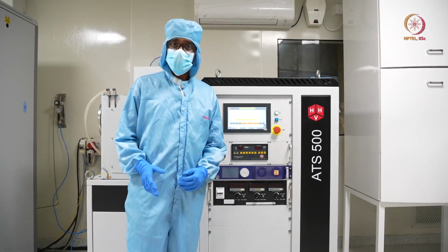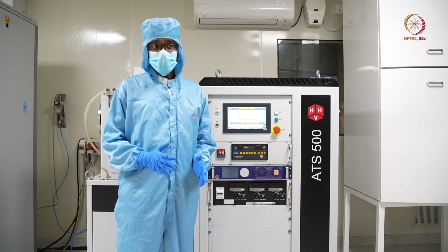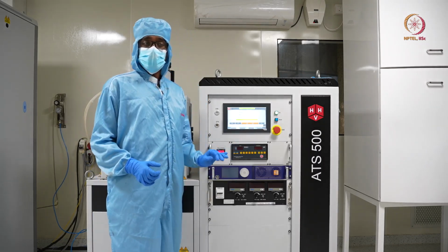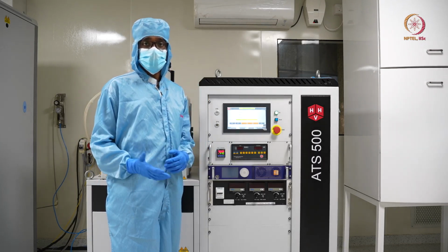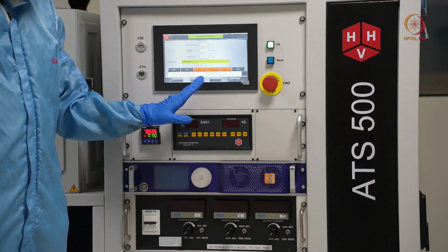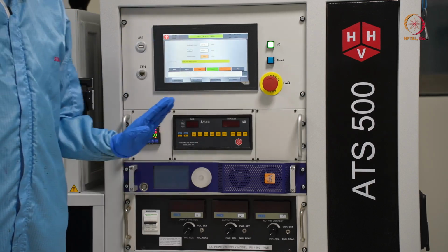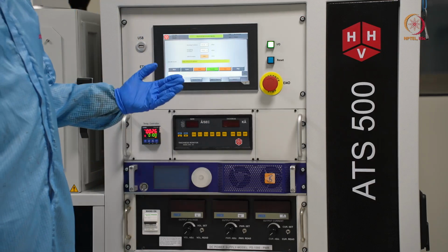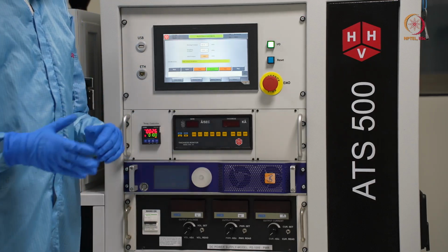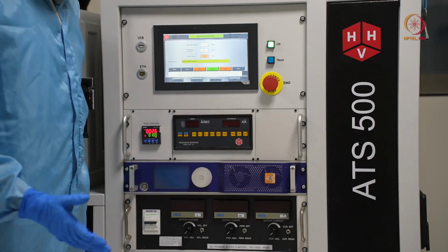So it is already on, but for safety reasons it is always recommended that whenever you leave the lab or you are done with the process, you should stop the gas flow everywhere, because otherwise it may lead to some accident. So after the argon we are pressing process here. In process mode, throttle pumping will first start, so the pump-down or suction by the vacuum pumps will not be full, but almost half open, or partially open.